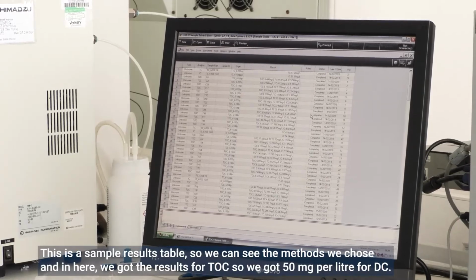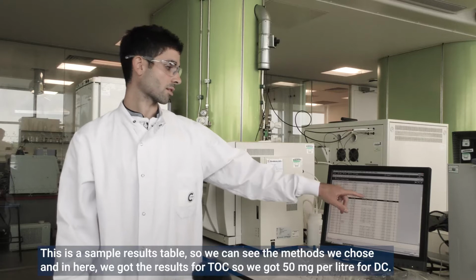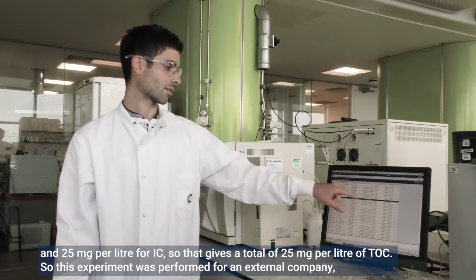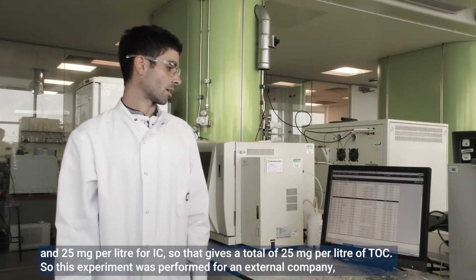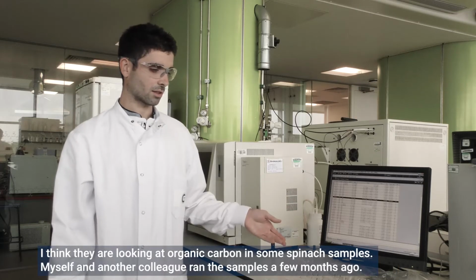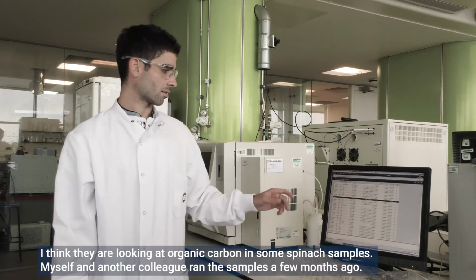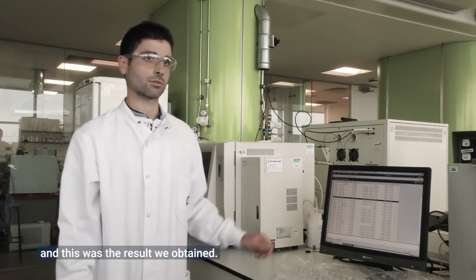This is the sample results table. In here we can see the method we chose, and in here we got the results for TOC. We got 50 milligrams per liter for TC and 25 milligrams per liter for IC. That gives a total of 25 milligrams per liter of TOC. This experiment was performed for an external company. I think they're looking at organic carbon in some spinach samples. Myself and another colleague ran these samples a few months ago, and this was the result we obtained.